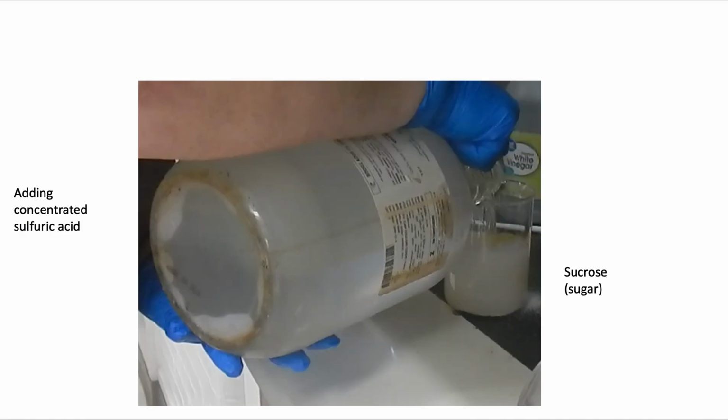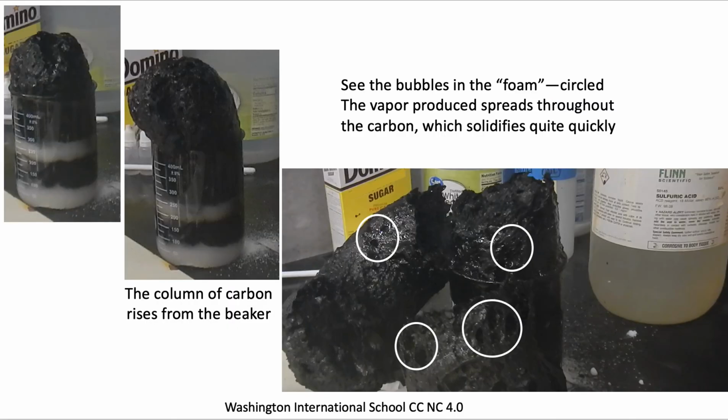We've got a couple more diagrams here, adding concentrated acid, and then looking more carefully at the product as it's formed, the column of carbon that's rising from the beaker. And when you look closely at it, you can see sort of where the gas bubbles had burst at the edge of the material.